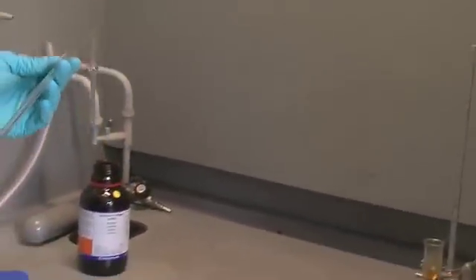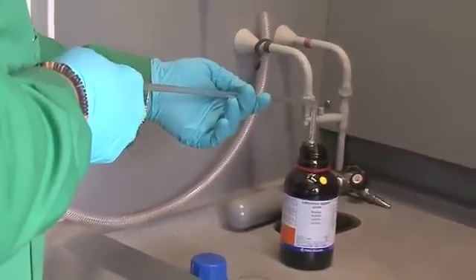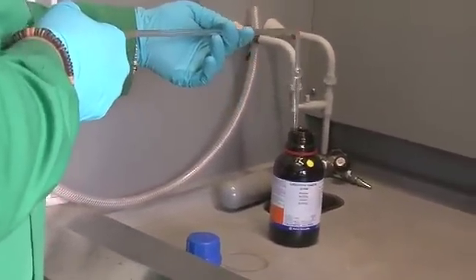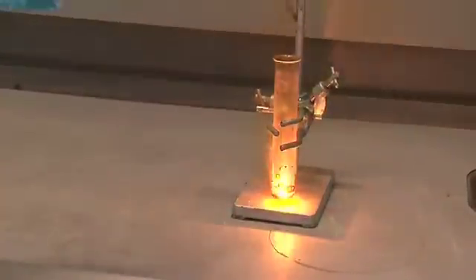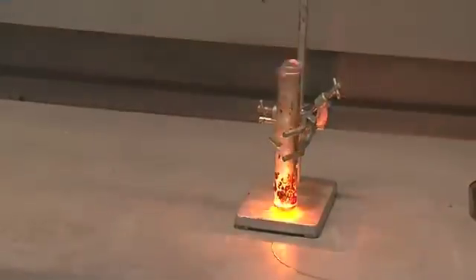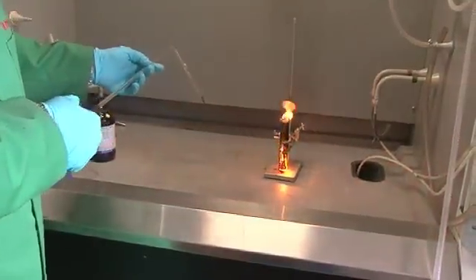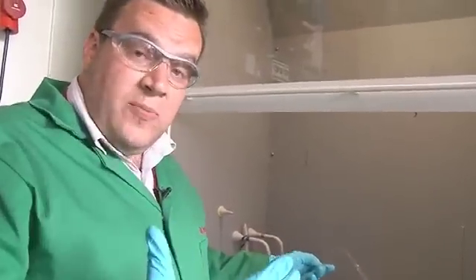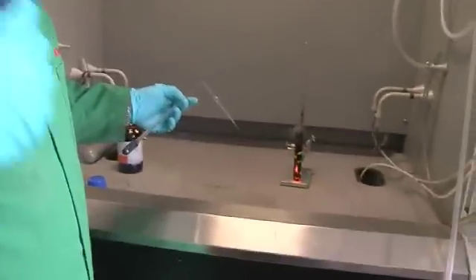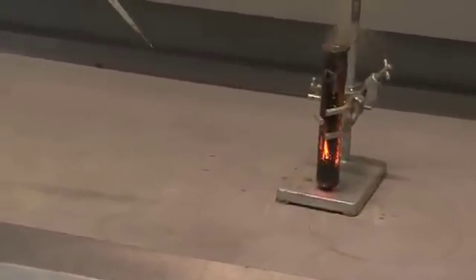Approximately a milliliter of aniline into the pipette, and then we'll add a few drops and see what happens. As you can see, the minute that I put the aniline in, it reacts spontaneously to generate lots of smoke — which you can see here as carbon — lots of CO2, nitrogen, and water vapor.